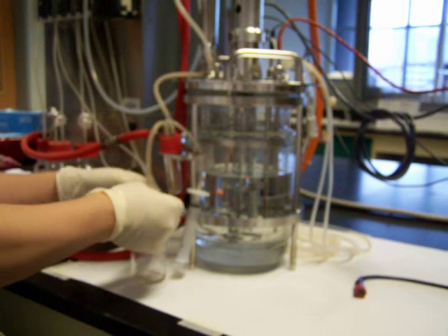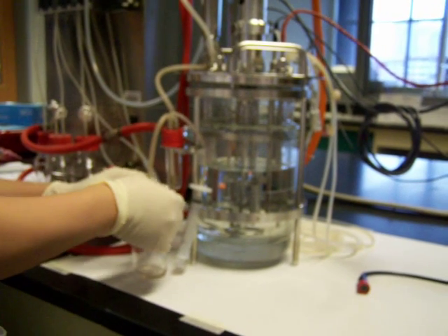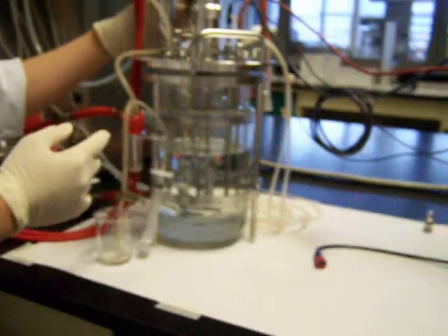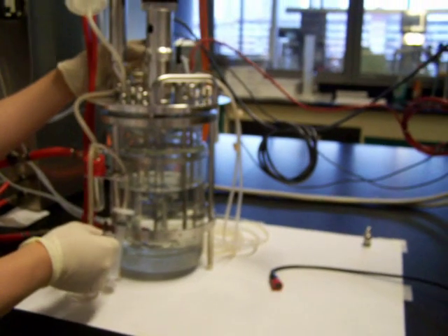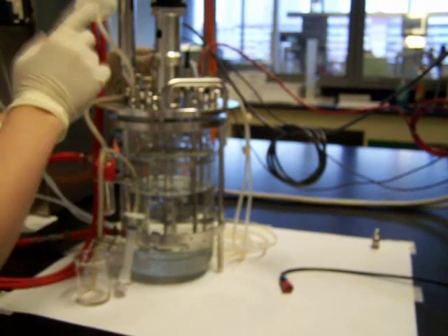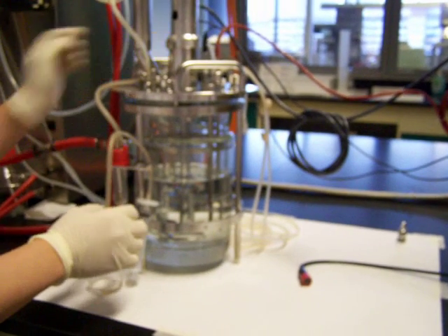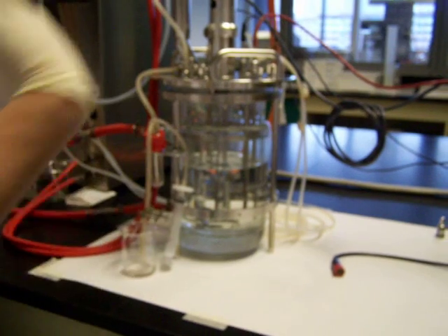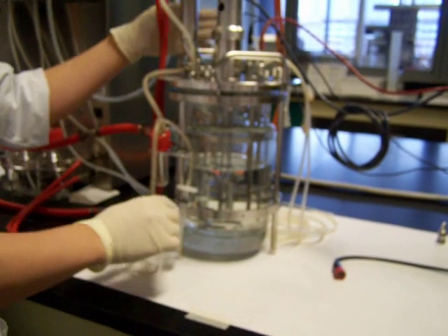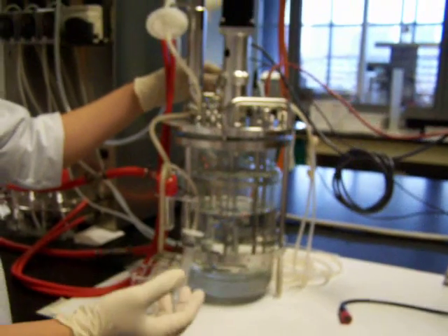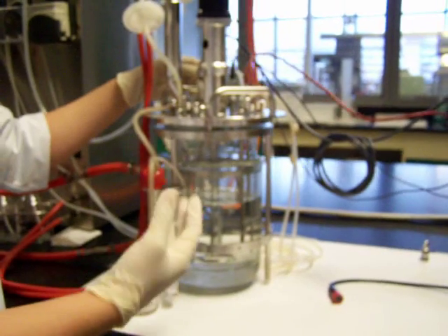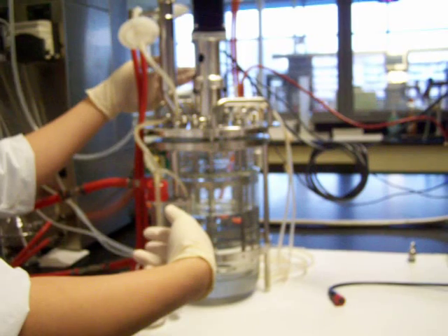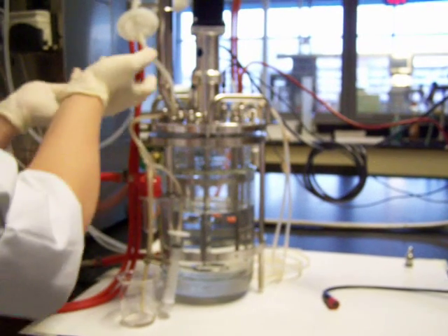The main mistake that some of you will make is this: it's not closed, and then you open this. Normally it's because the previous group didn't clamp it properly. The next group comes to take sample, never checks whether this is closed or not, assumes that their teammates are responsible. So they never check, then they open this. There will be two points that will be released at the same time.